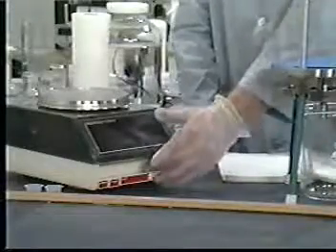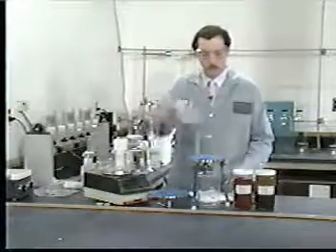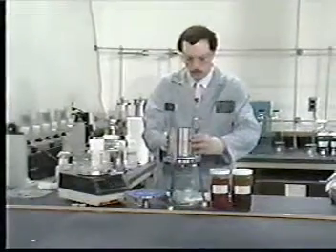But if the waste is liquid or multiphasic, then it must be filtered to separate the liquid and solid phases. We are going to see that filtration process in more detail when we do the extraction. So for now, we'll just go through it quickly. Pre-weigh the container which will receive the liquid filtrate. Assemble the filtration apparatus, placing a pre-weighed 0.7 micron glass fiber filter between the support screens and securing it.